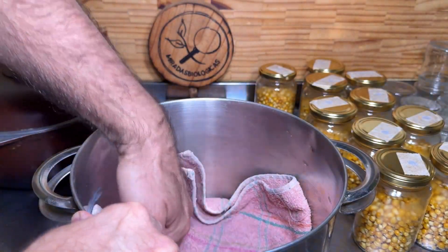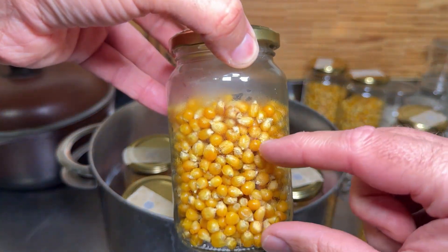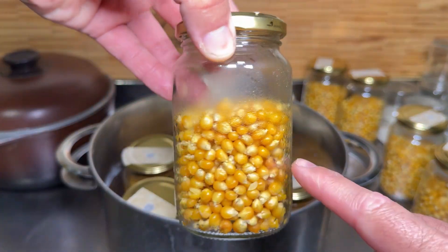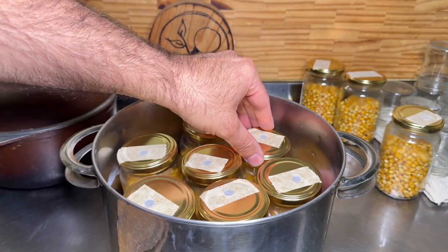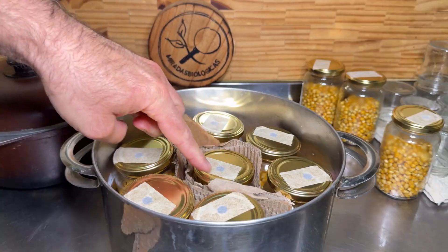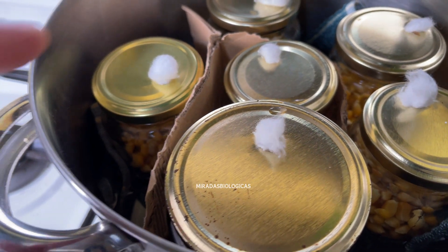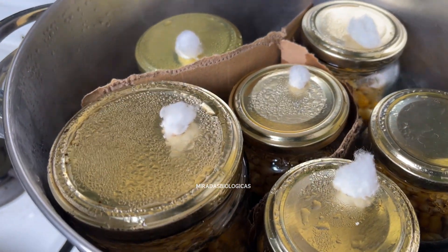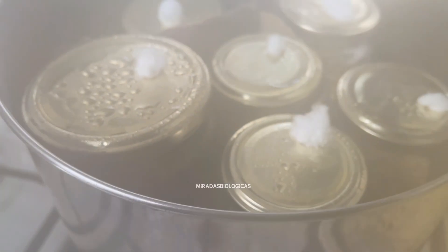Place a cloth on the bottom so the heat from the burner doesn't damage the base of the jars. Add water so it reaches approximately the middle of the jars to ensure good heat transfer into the jars, especially to the center where all the corn kernels are. One problem that can arise is that when this starts to boil, the jars can bump into each other — I solve this by placing pieces of cardboard between them. With the pot directly over heat, once we see it start boiling, we're going to leave it for 50 minutes to 1 hour. If the water is boiling too vigorously, turn the heat down to a minimum for more uniform sterilization.